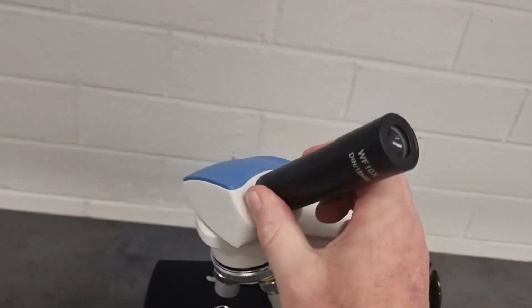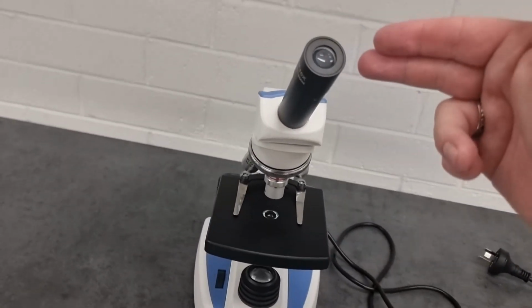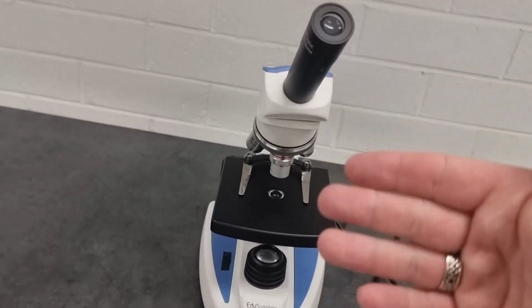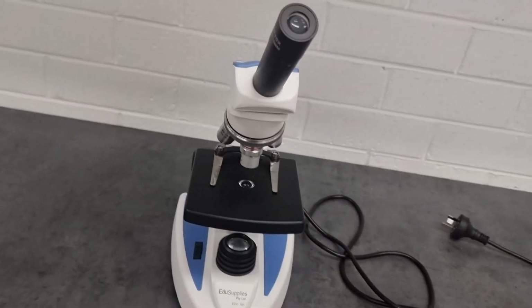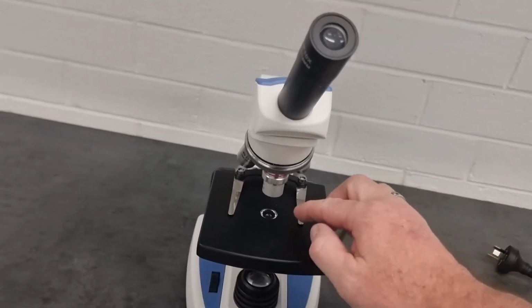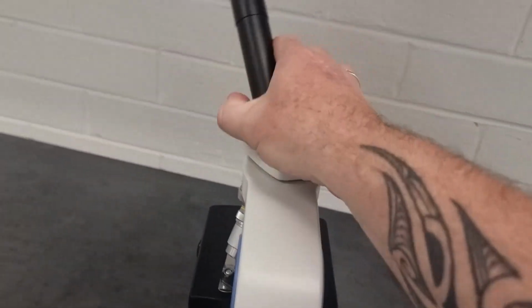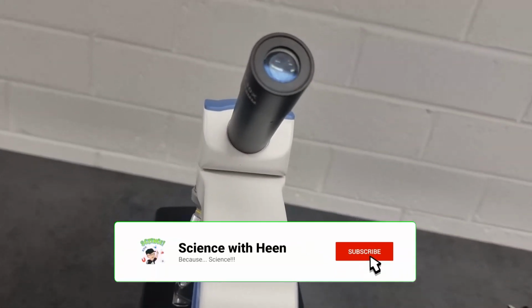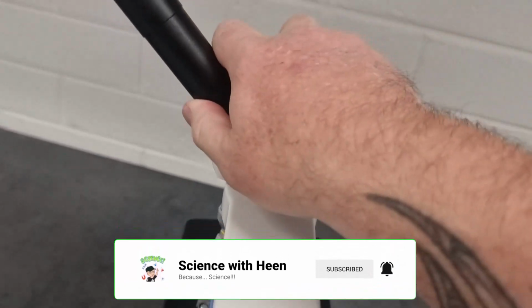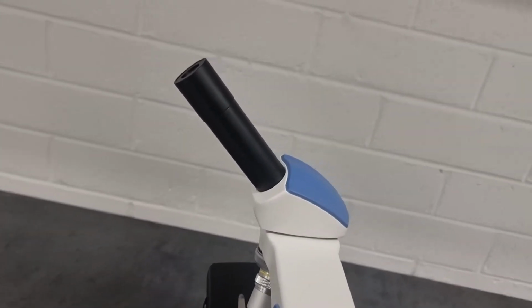Now, I also did mention you observe from behind the microscope. This barrel with the eyepiece actually swivels around. You wouldn't generally do this, because as you are looking down through the eyepiece, your face is right here, you're breathing right here, and so you might get some condensation or something like that simply from breathing on the slide. So you observe from behind the microscope. The reason that this does swivel is if you find something and you want to show someone, you could just very briefly say, hey, have a look at this. They could observe from the side. But in general, you observe from behind the microscope.